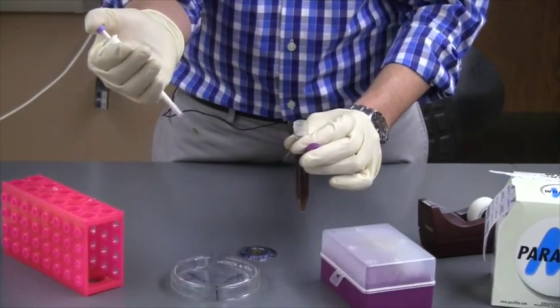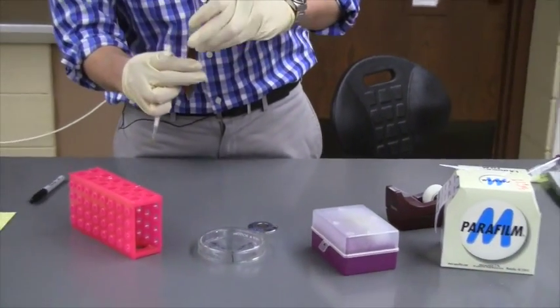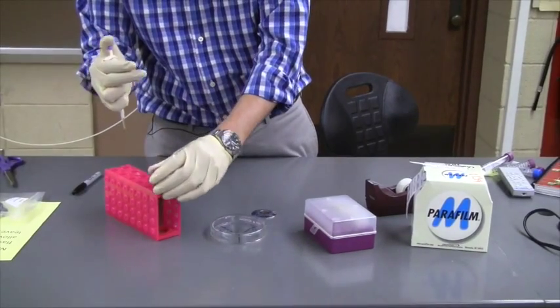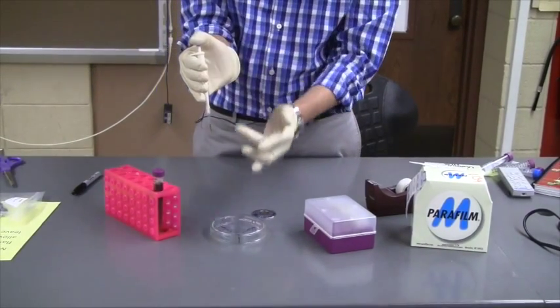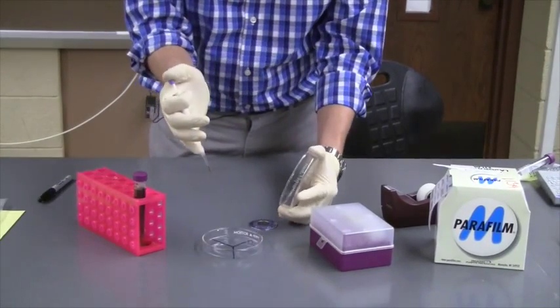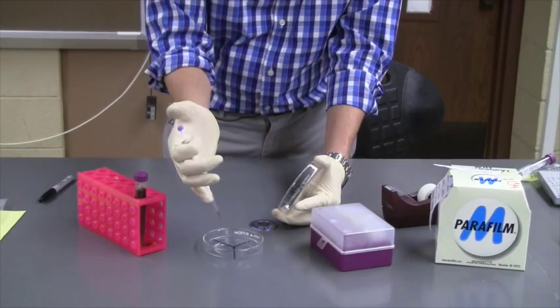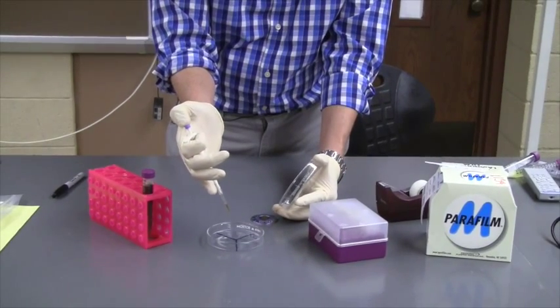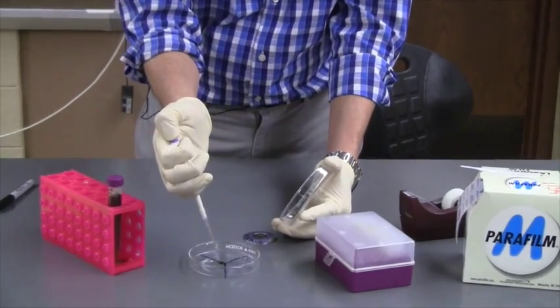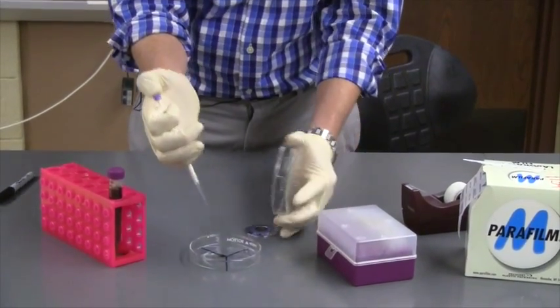I have acquired a sample. I'm going to put the lid back on my bacteria and I'm always going to carry the pipette vertically so that the sample stays down in the bottom of the tip. Then to discharge the sample, I'm going to push all the way down to the second stop. There we go. I have discharged 50 microliters onto my plate.